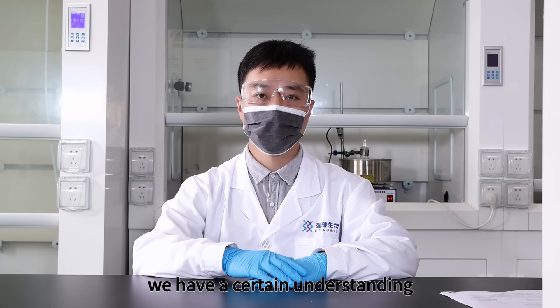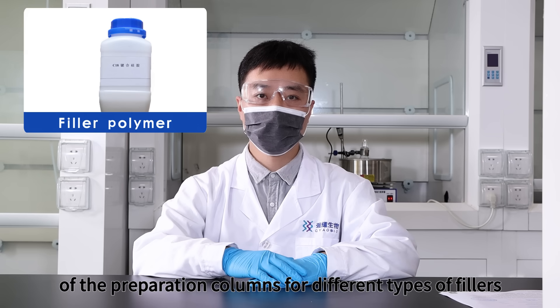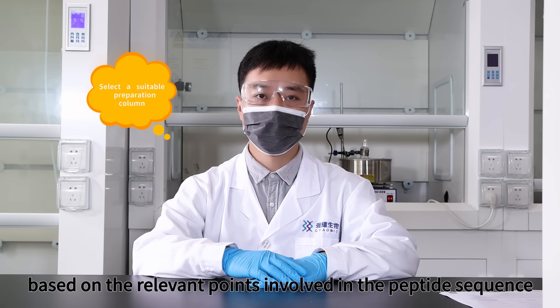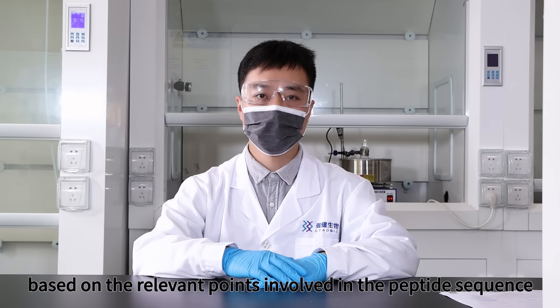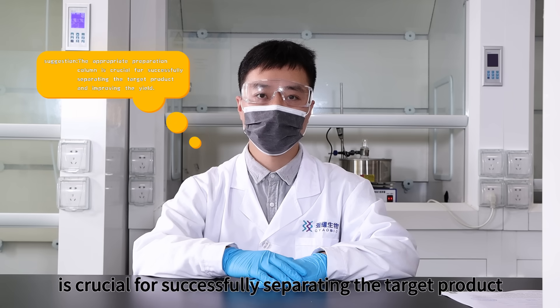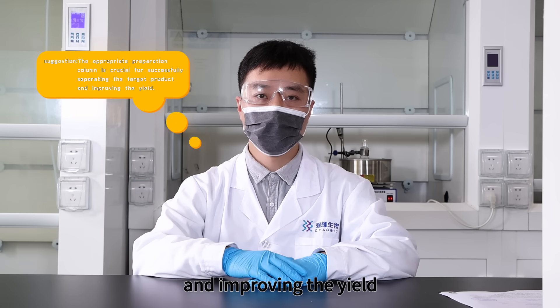Step 3: Select a suitable preparation column. First, we need a certain understanding of the preparation columns for different types of fillers, and then select the appropriate preparation column based on the relevant points involved in the peptide sequence. The appropriate preparation column is crucial for successfully separating the target product and improving the yield.